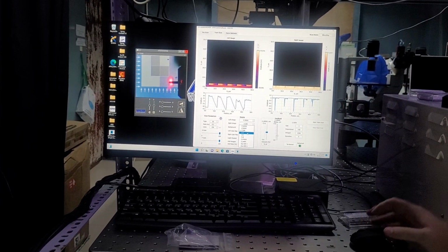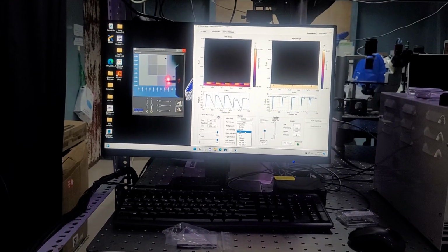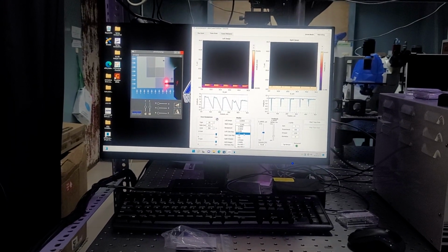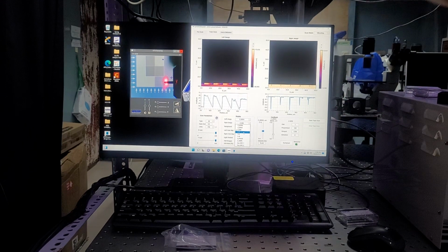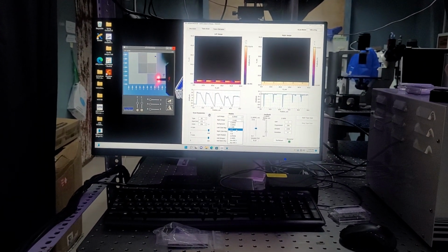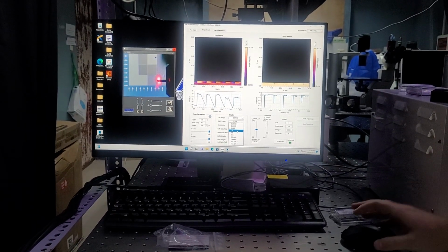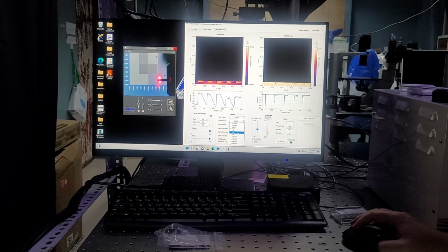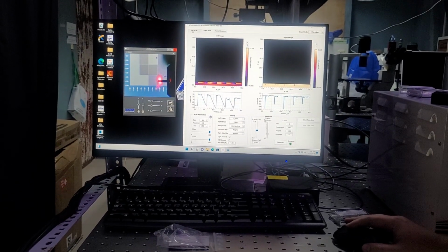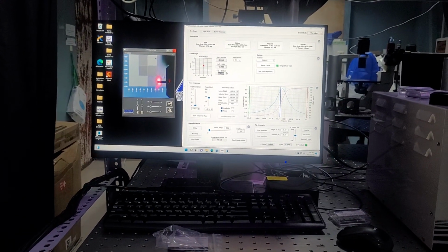Then you have left minus right. In vibrating mode, this will do nothing. It'll just spit out a bunch of nonsense. In non-vibrating mode, this is where you're able to scan at 90 degrees up and down in order to take a lateral force or a torsional measurement. I'll show you that once we cover non-vibrating mode. For top minus bottom and top plus bottom, this is just a live readout of your top minus bottom or your top plus bottom values as you scan.